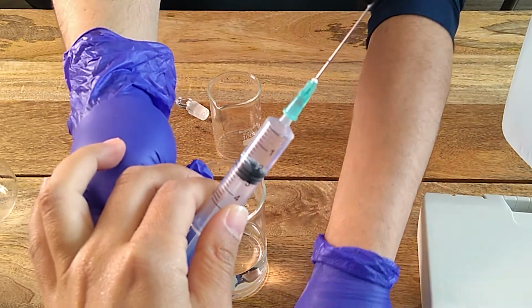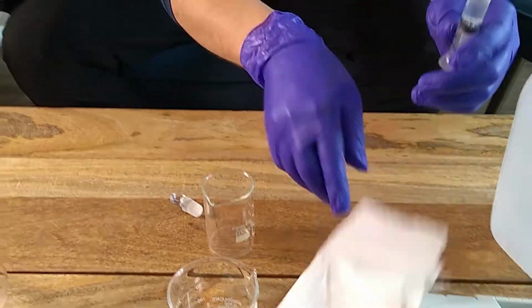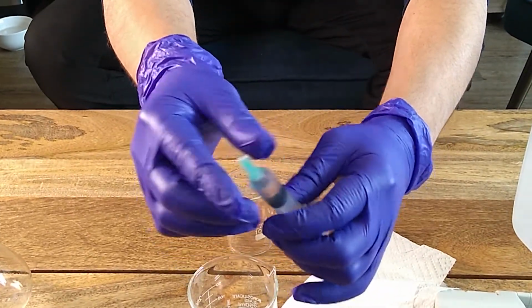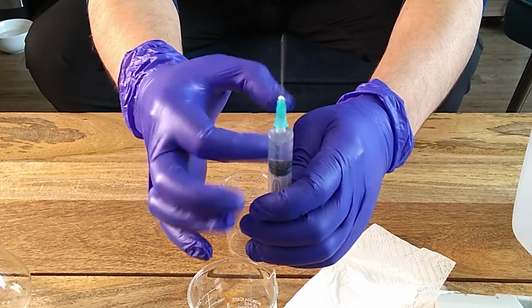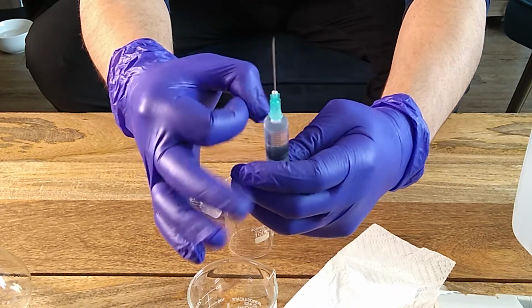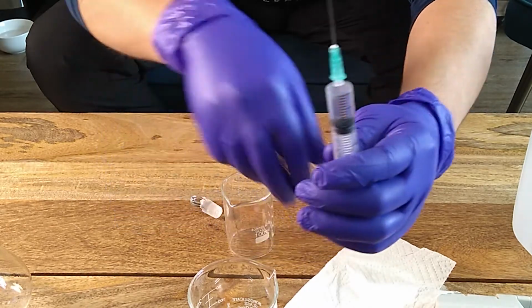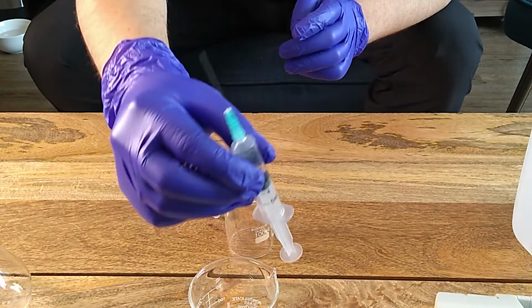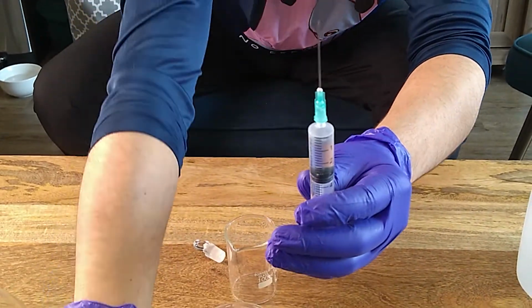And now what we want to do is, first of all, take out all the air, because there's a lot of air there. So I just flick it, and you can also shake it a little bit. Take out all the air so that it rises to the top. That gives you the most accuracy, because you don't want to measure volume of air. You want volume of whatever concentrated thing you have. So a good tip, if you draw a little bit and you draw a little bit of air, then you can shake it a little bit so that all the air just goes to the top of the thing.